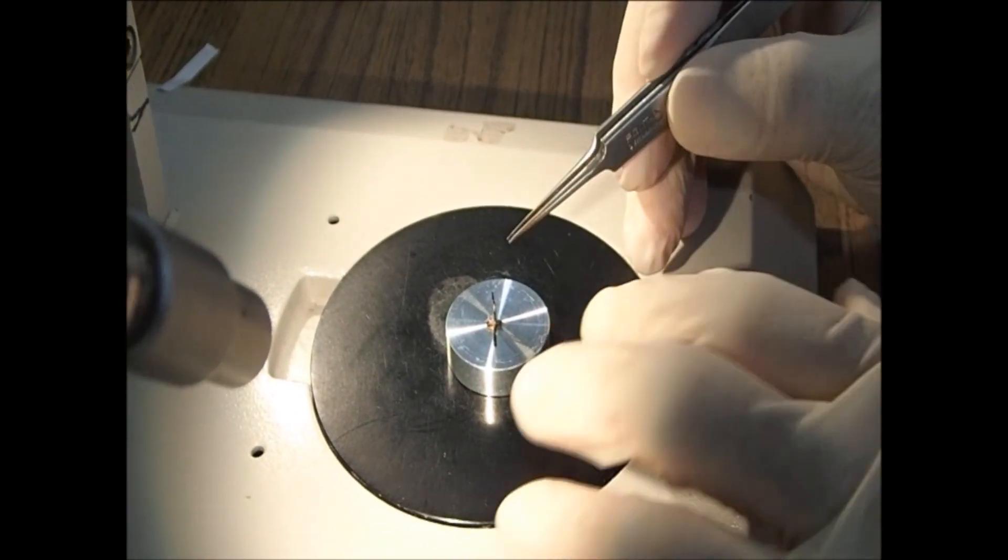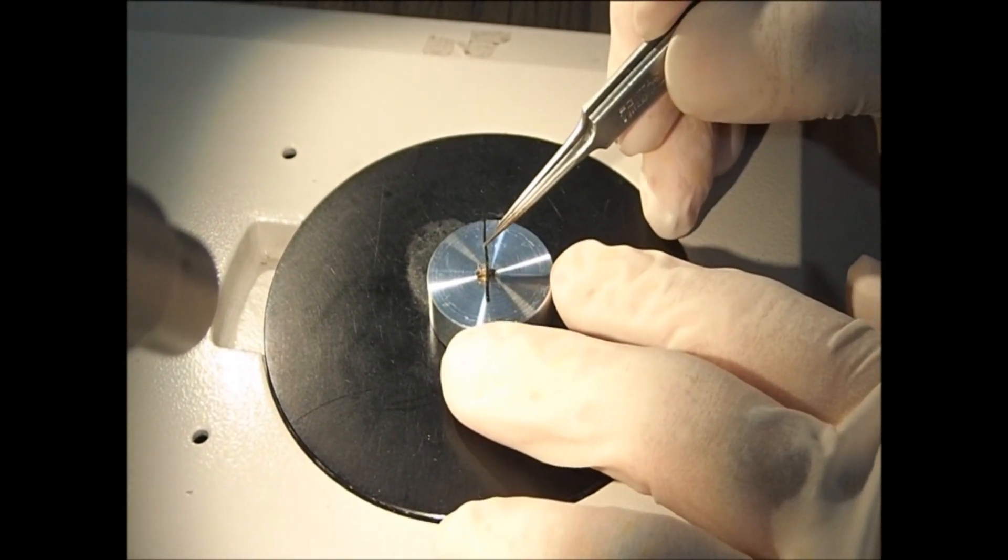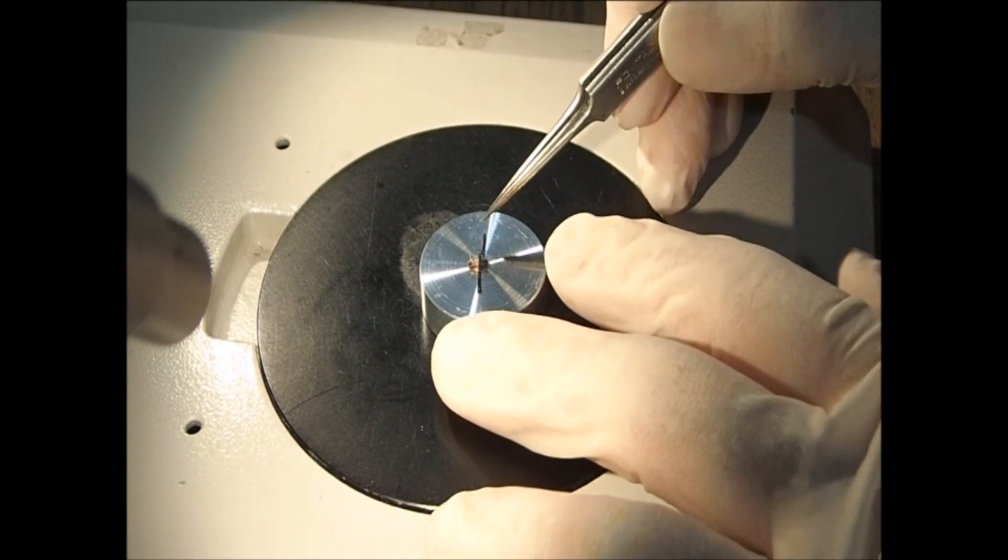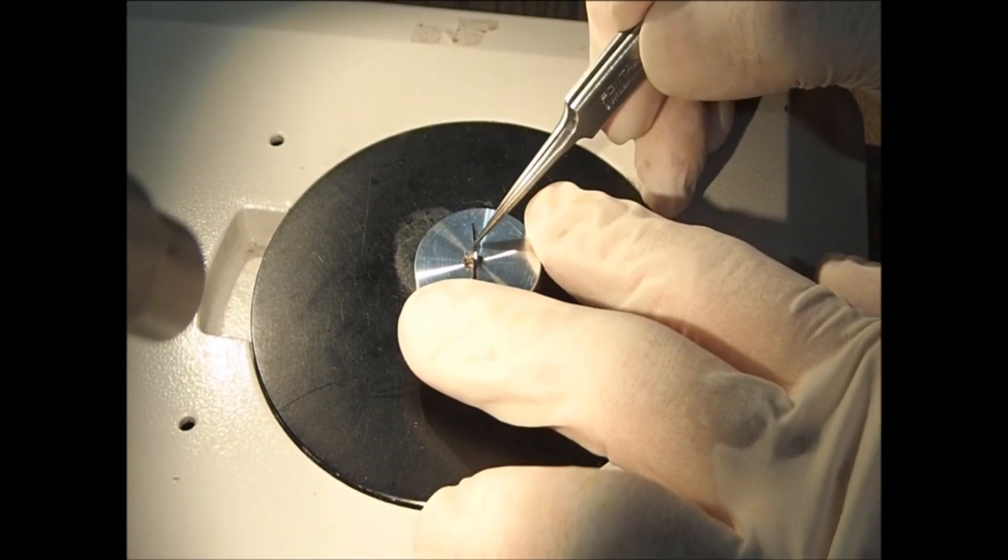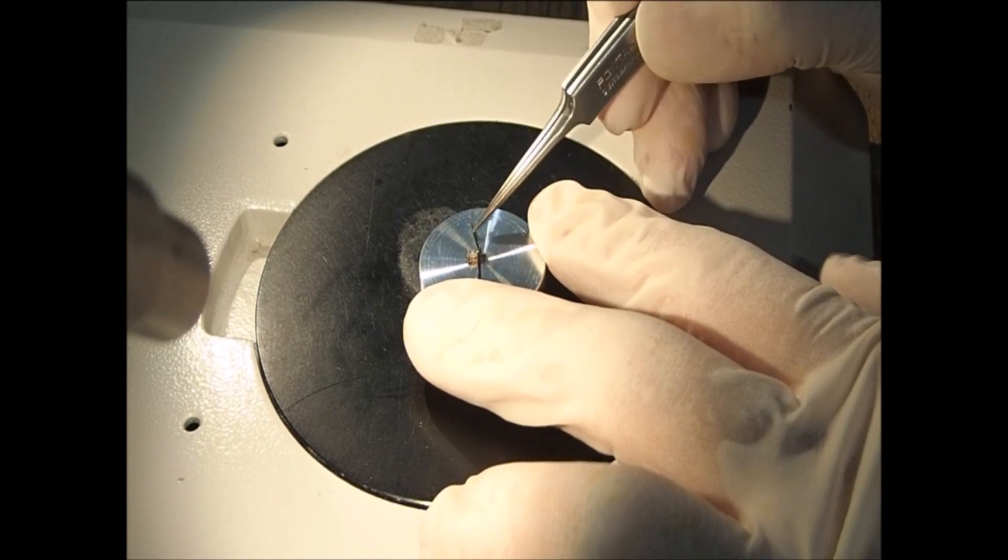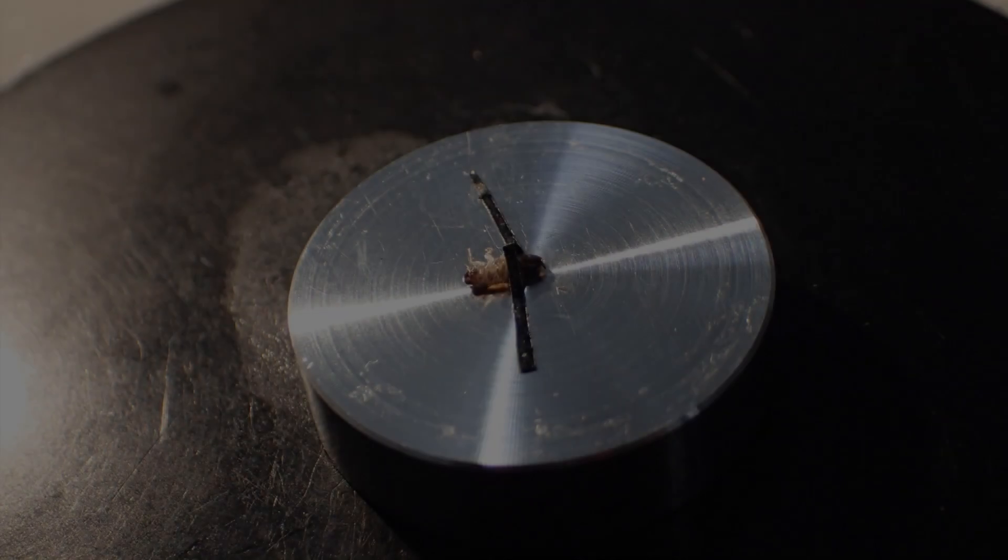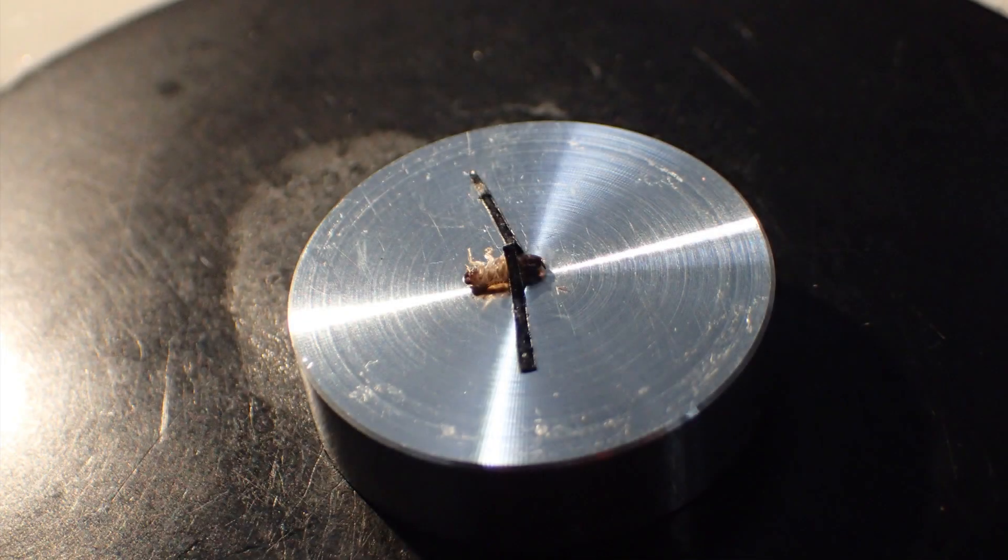Then, either hold the sample with conductive double-sided tape or place the sample on the double-sided tape to fix it. In this video, the sample was held with conductive double-sided tape.